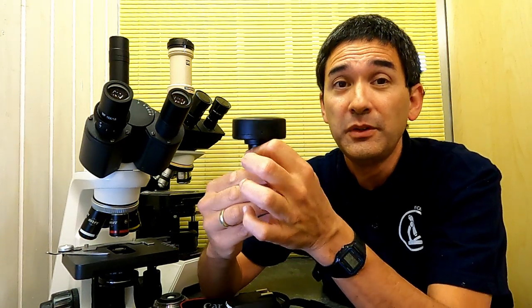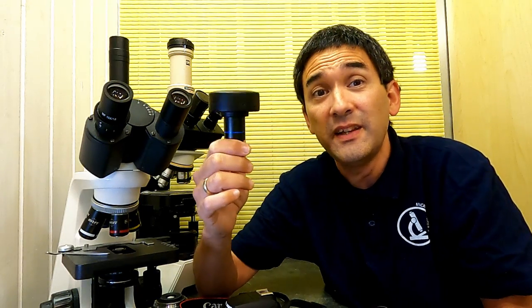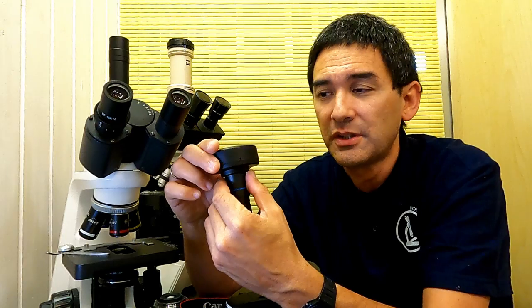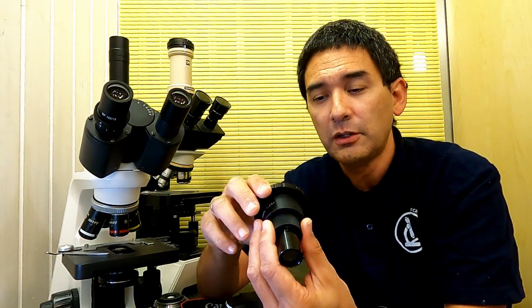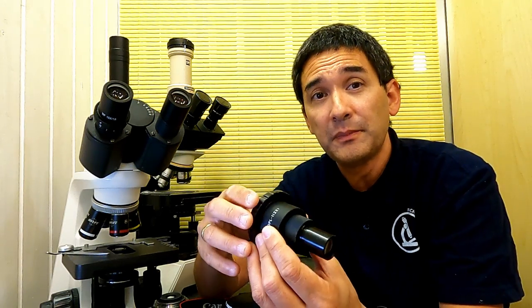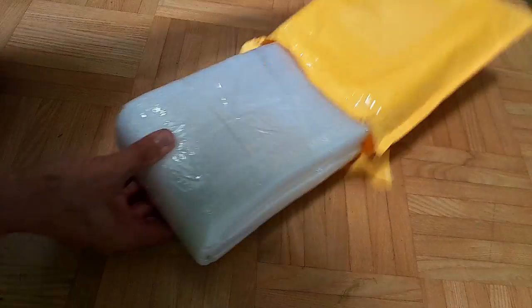But these USB cameras have one fundamental disadvantage, and that is video. The USB 2 connection is generally too slow to make a high quality video. Yeah? So that's a little bit the problem. So the frame rate is quite low. But what I'm going to do now is start unpacking this adapter here, and I'm going to show you now the fundamental problems that I found with this adapter. Well, so this is how it arrived.